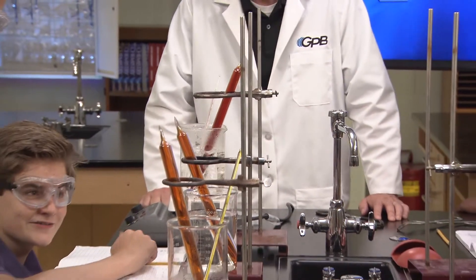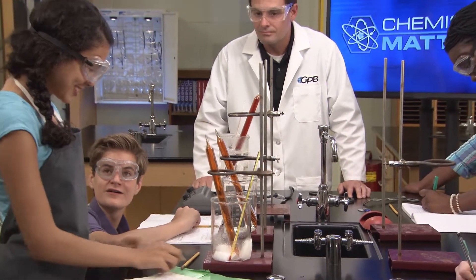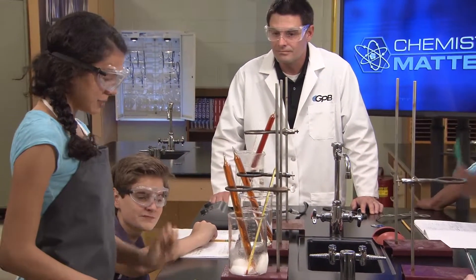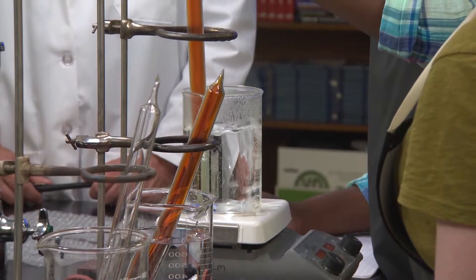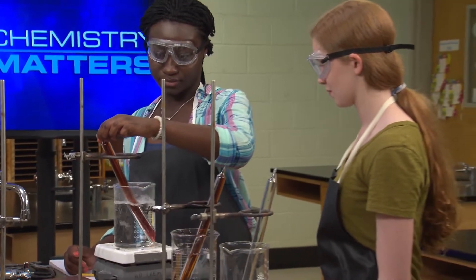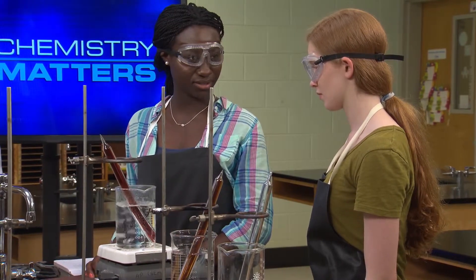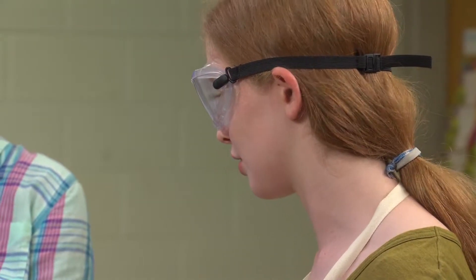Look, the dry ice is already making the gas turn lighter. I'll start recording some of our data. Why don't we leave the tube in the hot water for a while? I'll bet the hot water is making it darker if the ice is making it lighter.